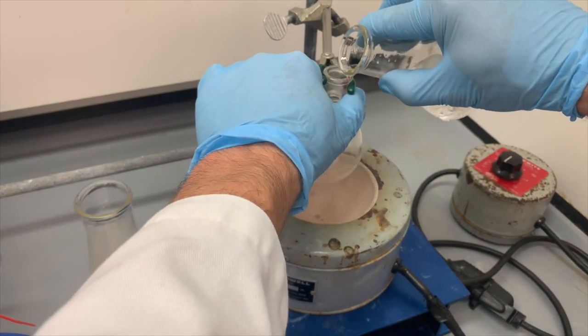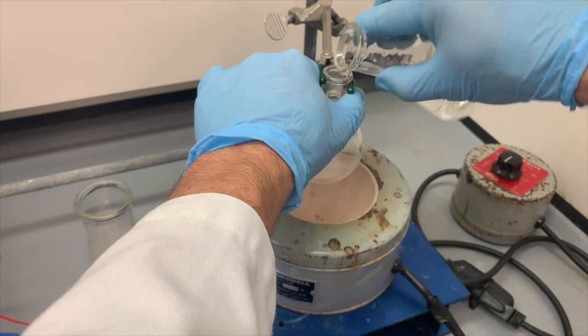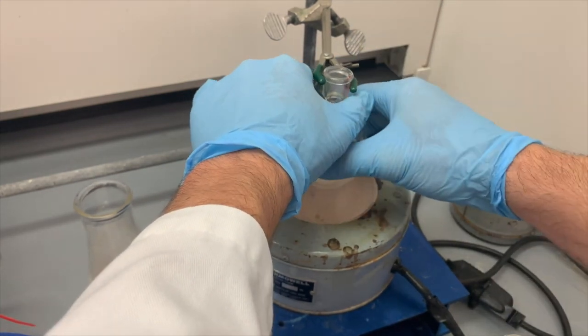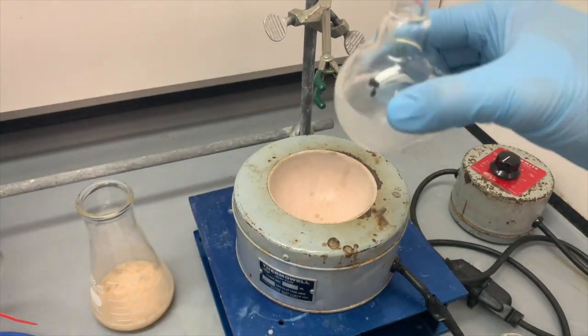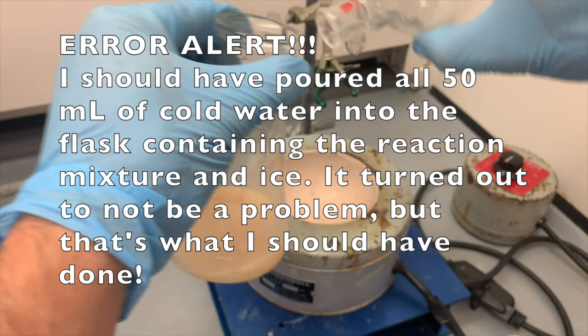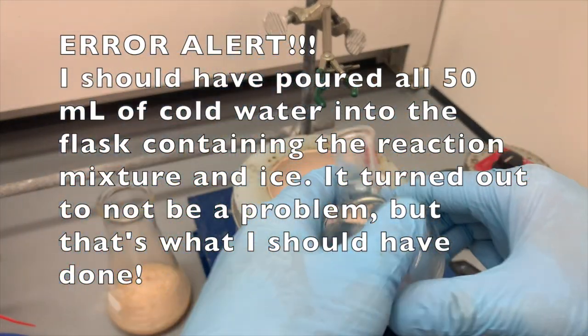We can add that. Should be using a funnel here, but you know. Add that, swirl, make sure we get all of the contents of the round bottom flask into our Erlenmeyer flask.